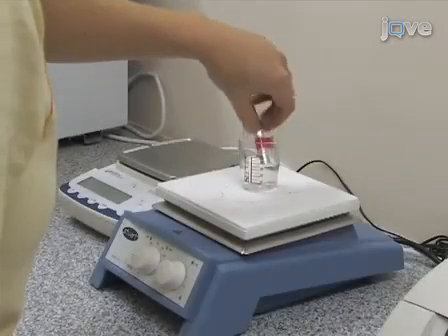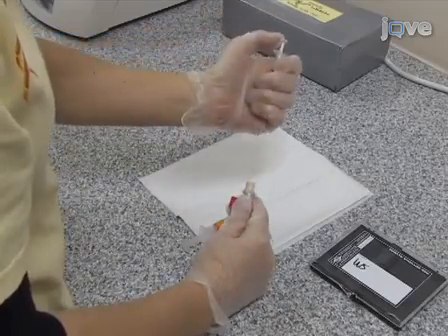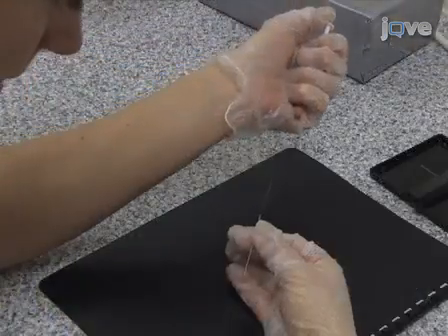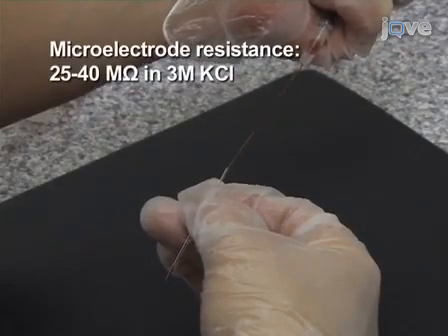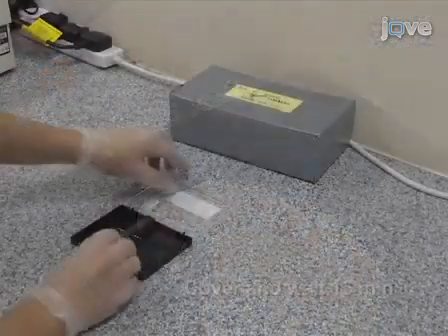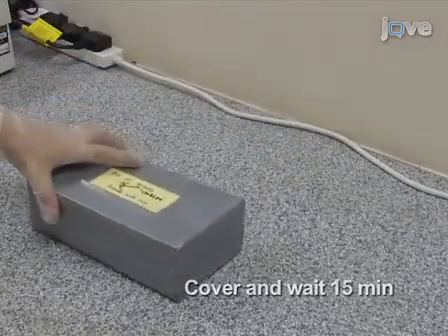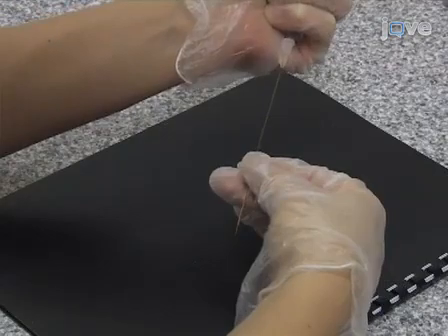When the dye solution is defrosted, draw up enough of the dye solution to fill approximately 2/3 of a microfill needle. Inject the dye solution from the microfill needle into the tip of a glass microelectrode. Cover the dye-filled electrode with a box and wait 15 minutes. Then, backfill the microelectrode with a 3 molar potassium chloride solution.